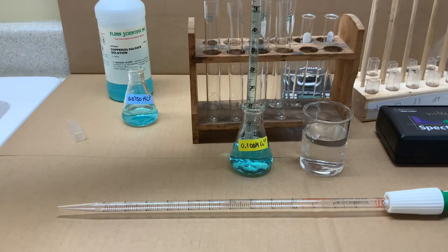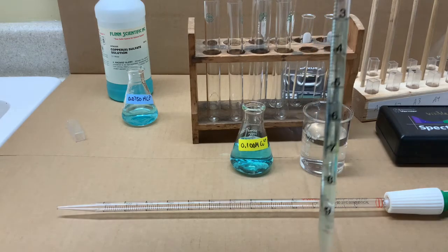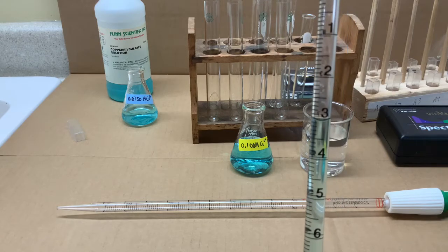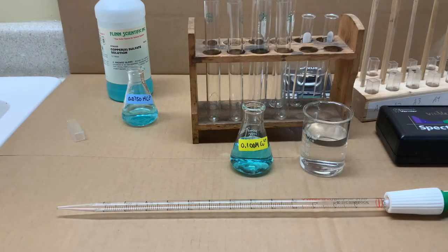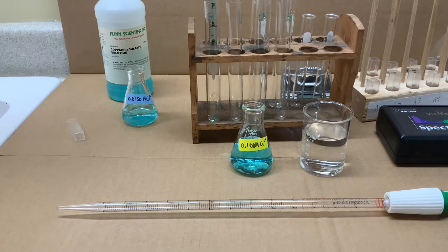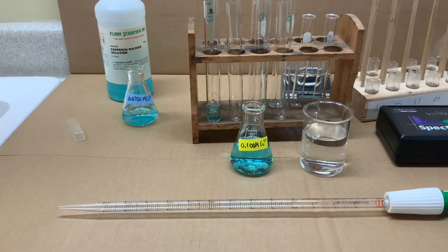Which would be 7 milliliters to make the first solution. So we'll draw up to the 3, and then push all of the solution into the test tube, which will release 7 milliliters into the test tube.